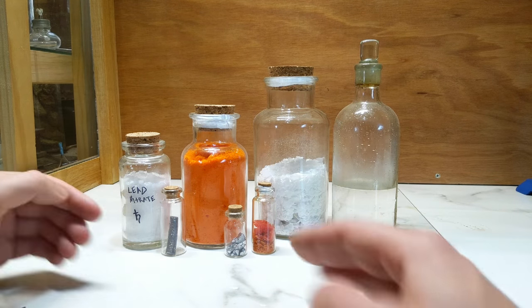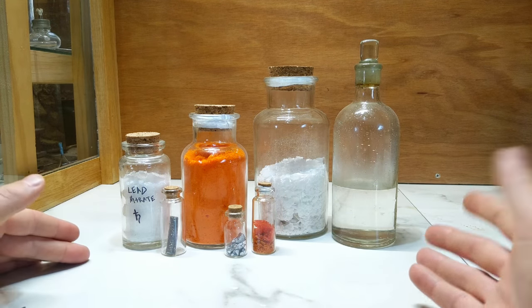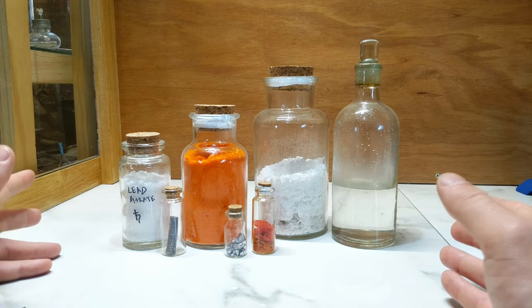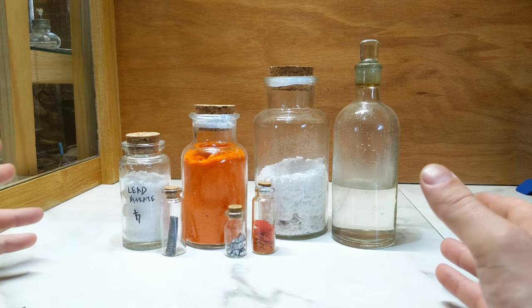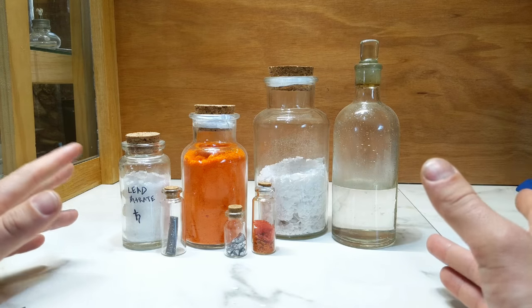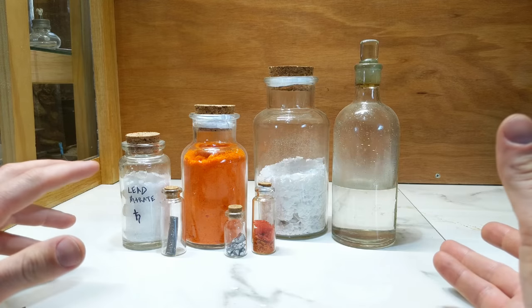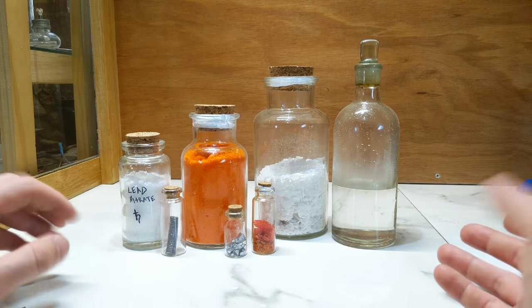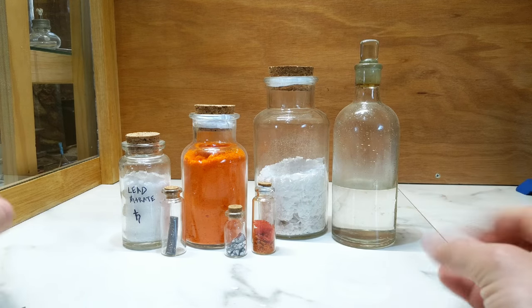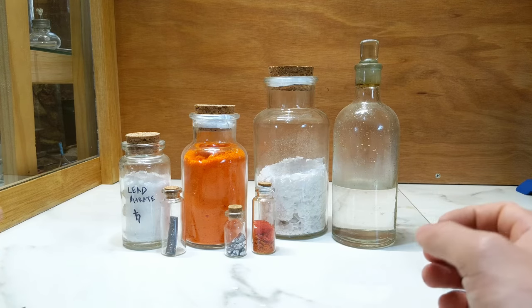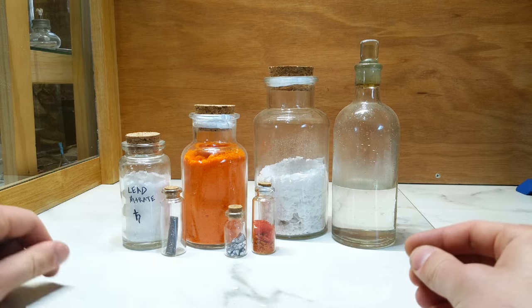So we should be able to, through these materials, get a fairly big spectrum from very pale yellows through the whole gradation of sun yellows and deep yellows and really warm yellows, right down to vibrant oranges and potentially, if we're lucky, even some really deep red colors or even a chromate vermilion would be a nice outcome from this.